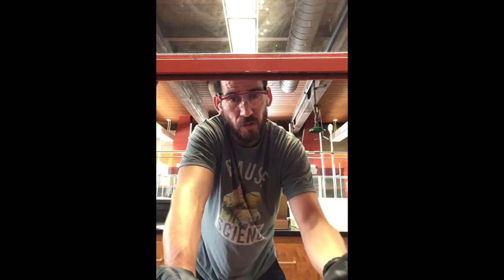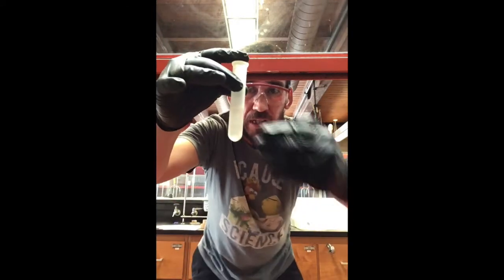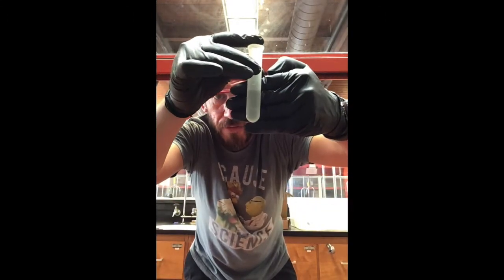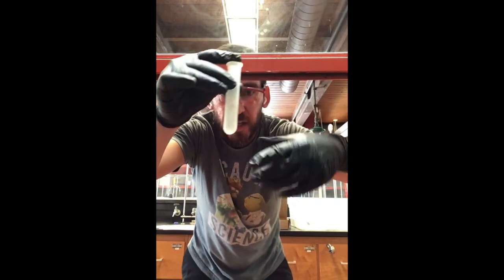But we also know that we had 4 mils of water, right? And we had only 2 mils of methylene chloride. So this is a little trick for you, okay? You can kind of see which volume is greater. So there's one portion and there's a smaller portion. That smaller portion is on the bottom. That kind of goes along the lines of where methylene chloride is, right?